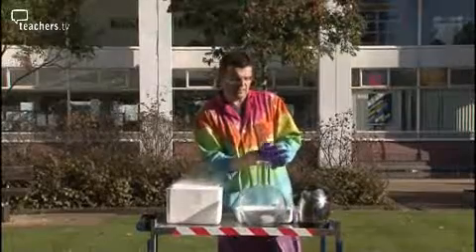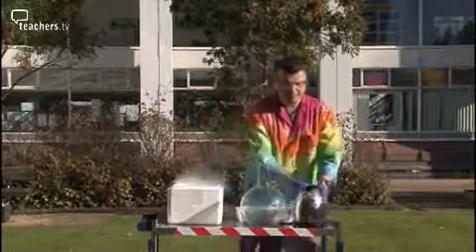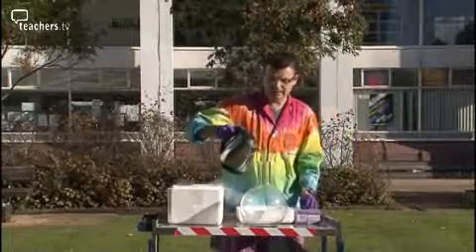The first thing we're going to do is demonstrate the sublimation and some of the interesting associated properties. I'm pouring some boiling water into my flask with some food colouring. The food colouring is there to provide a contrast.